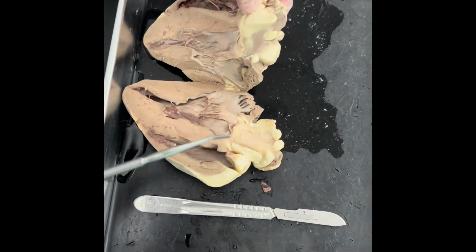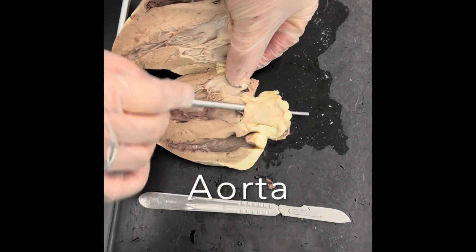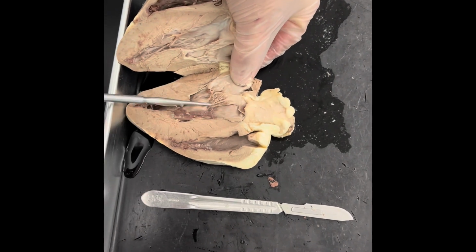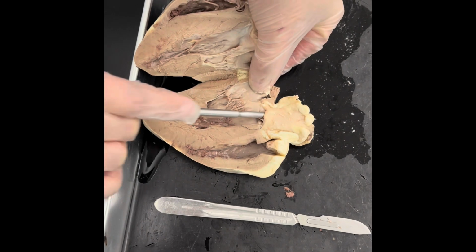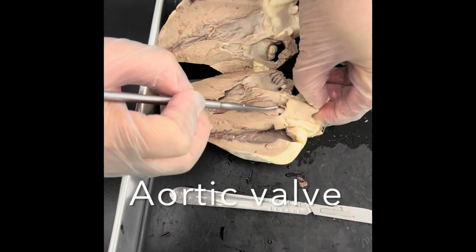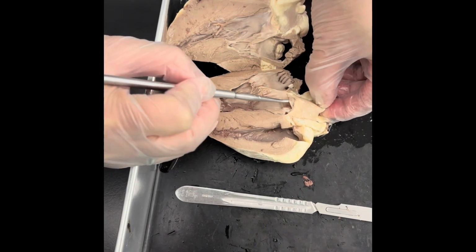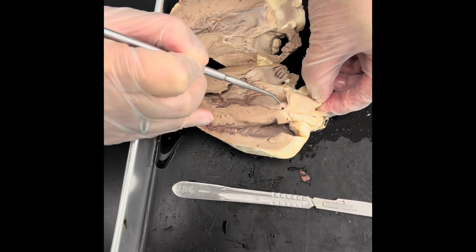And then you can also see some of the blood vessels. For example, this one right here is the aorta. I know it because it's parallel to the left ventricle right here. And then this is what we know as the aortic valve. See part of the leaflets right there.